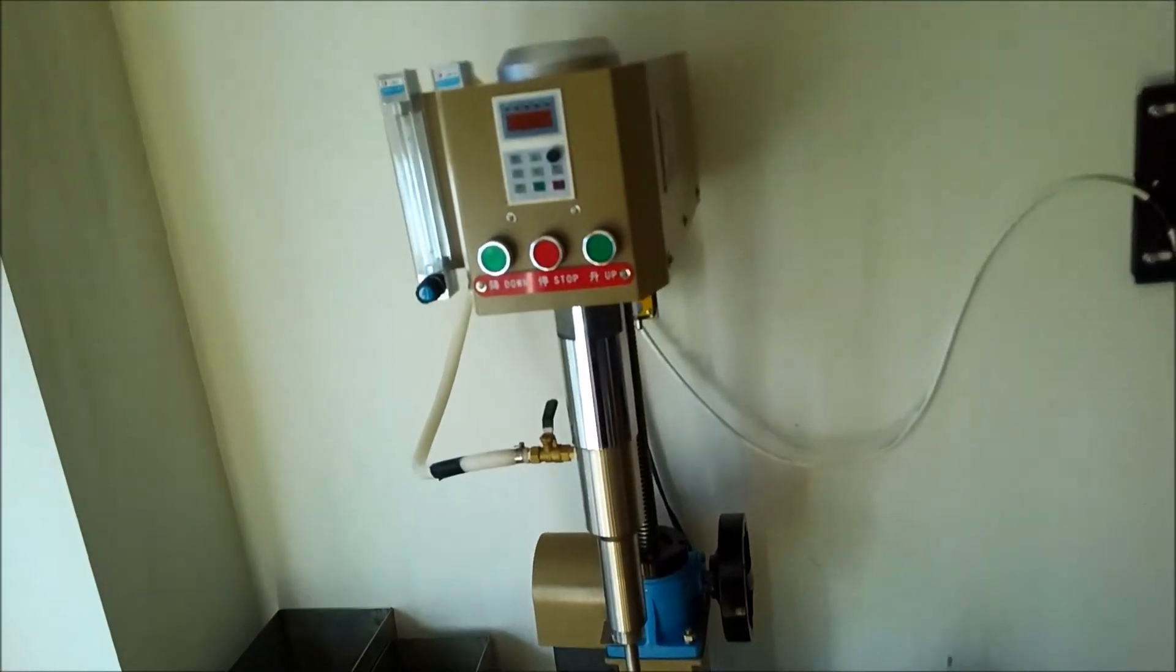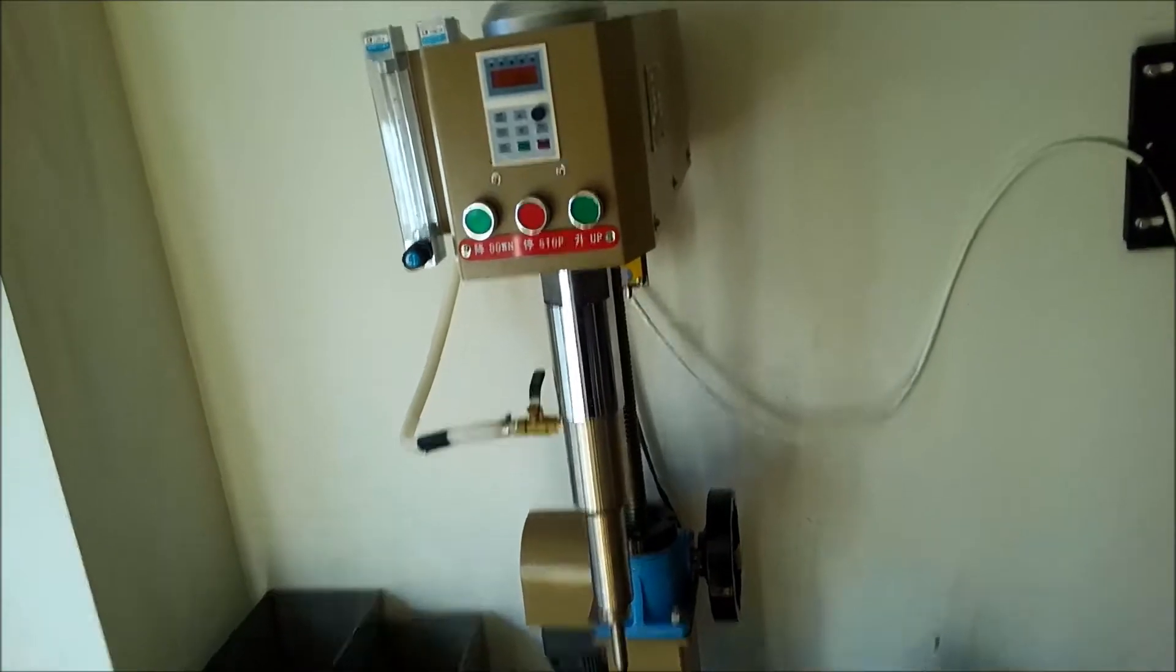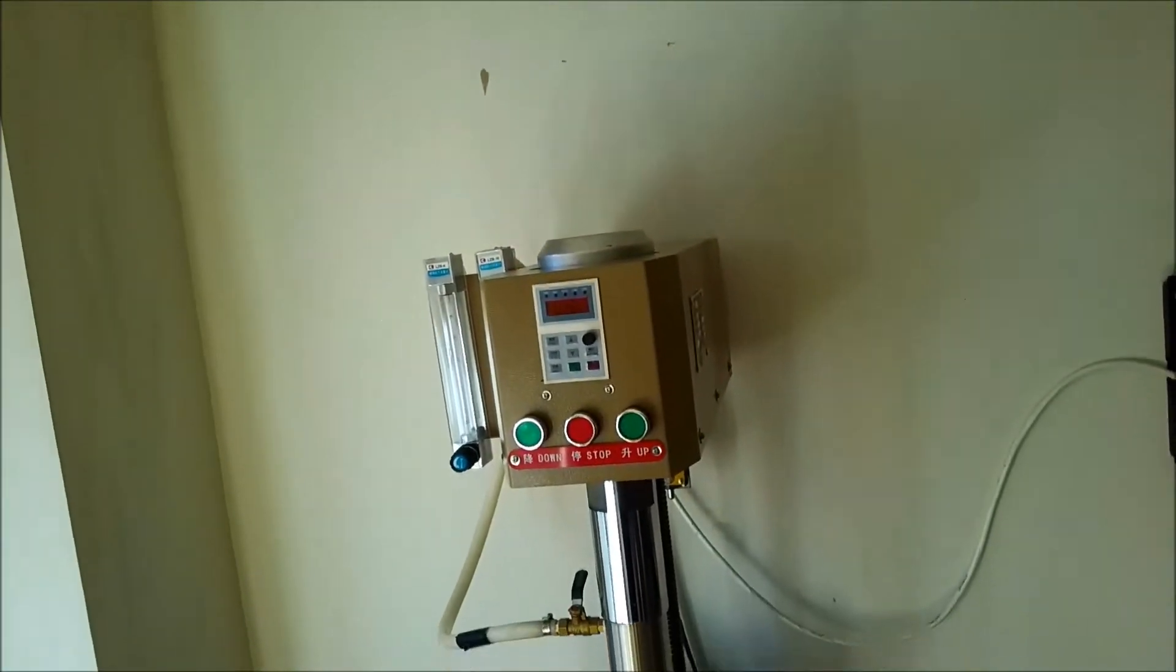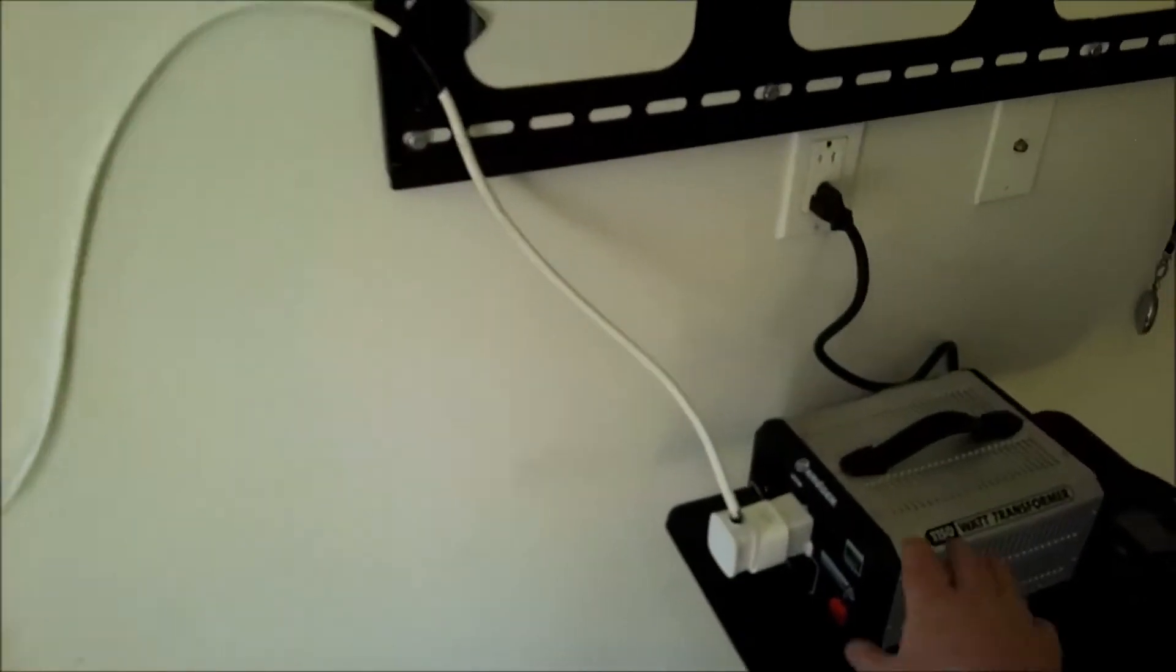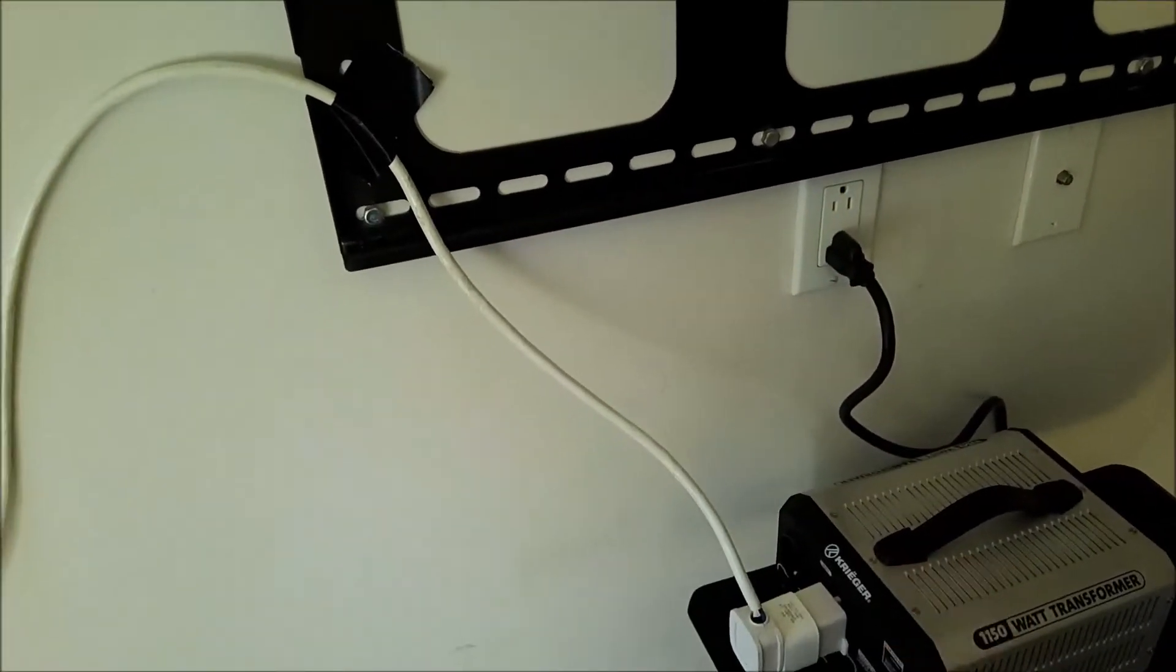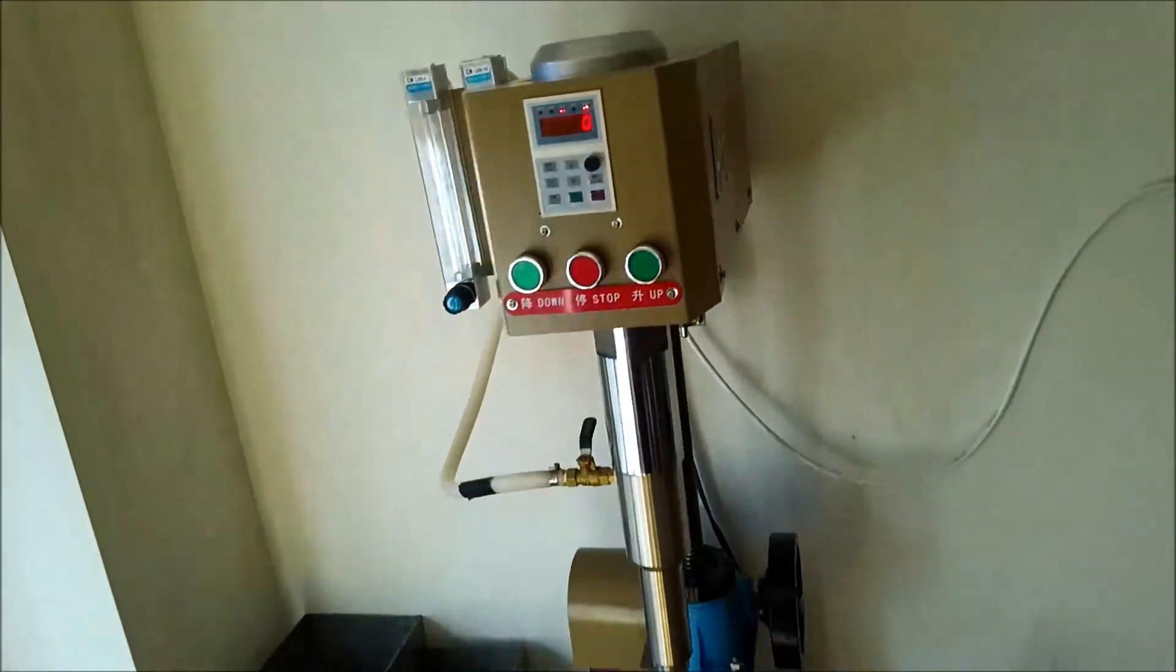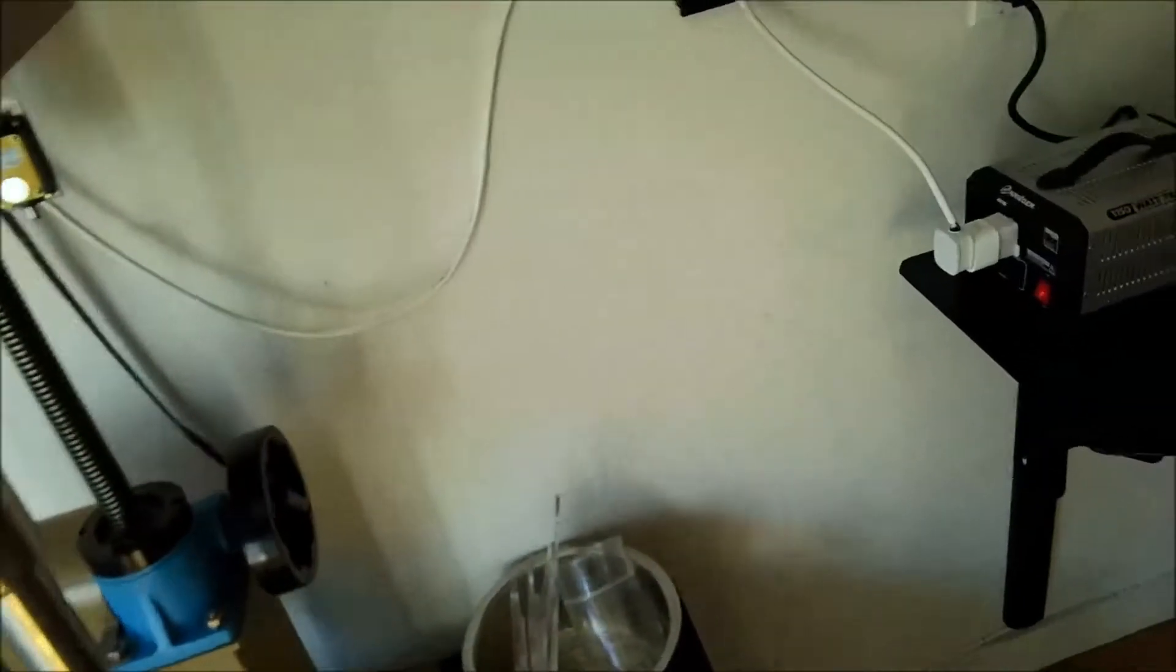This is 220 volts. It can be 50 or 60 hertz. It is single phase. So I've connected it to a step up transformer because I'm on 110 over here. It looks funny because I just improvised with a bunch of plugs.